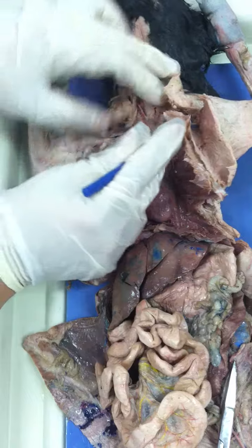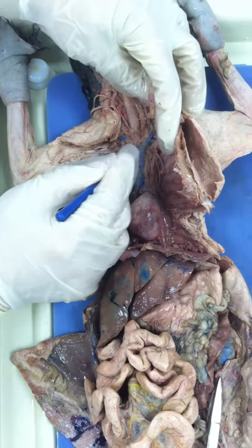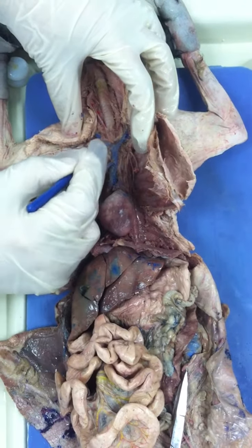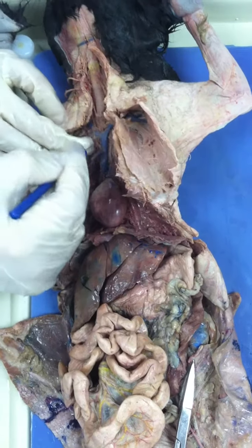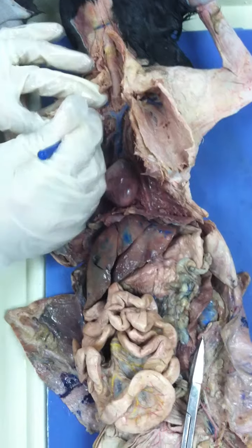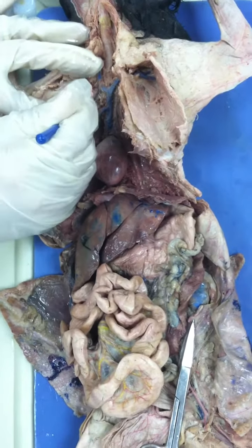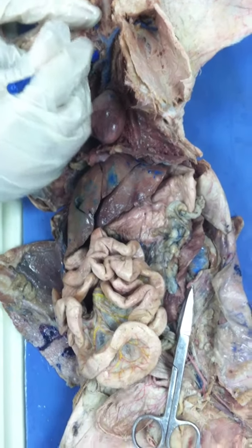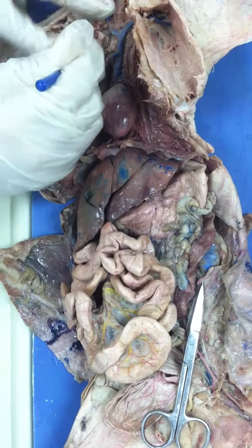Now here, we encountered this vein. So they look kind of like a little vein. Brachiocephalic. Very good. So this part here is the left brachiocephalic, and this is the right one. Now here we usually have an anatomical differentiation that the vertebral may branch out from the brachiocephalic or from the superior vena cava, so you have to keep that in mind.